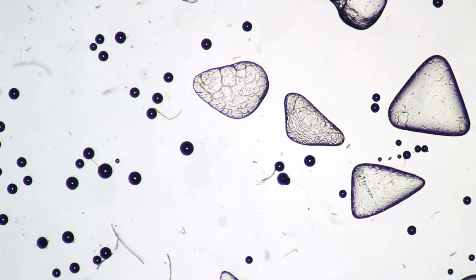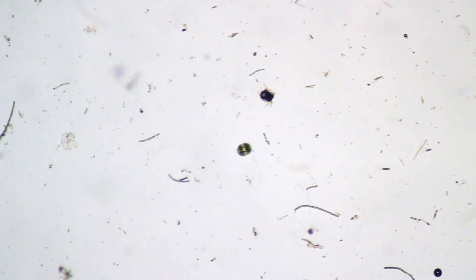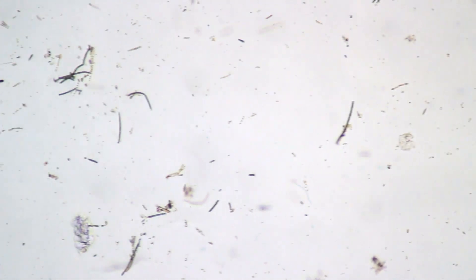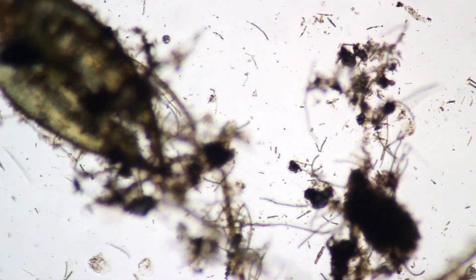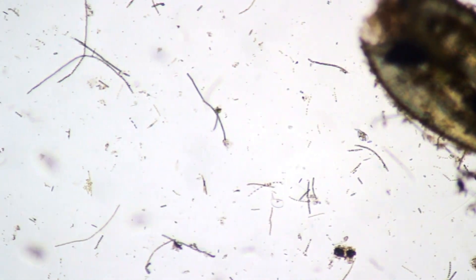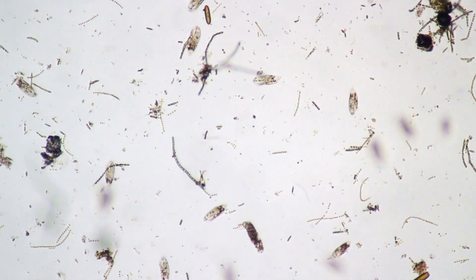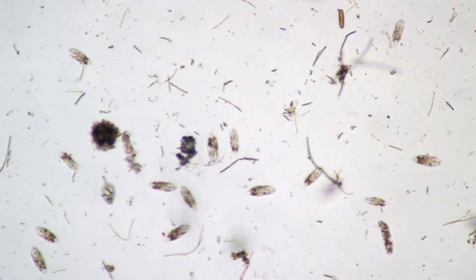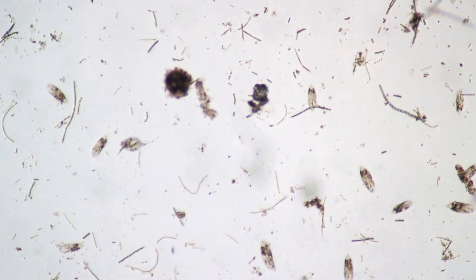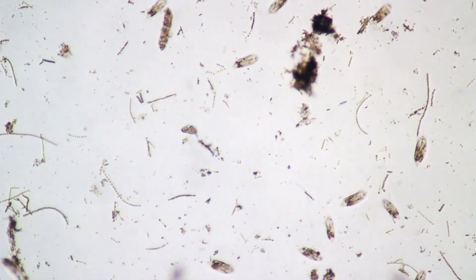These here are the salt grains dissolving. You add a little bit more water beneath the cover glass so that the salt can be dissolved. When the salt grains dissolve, the salt water will diffuse across the slide and the microorganisms will move away from it. A few millimeters further away you will see them all concentrated on one edge.